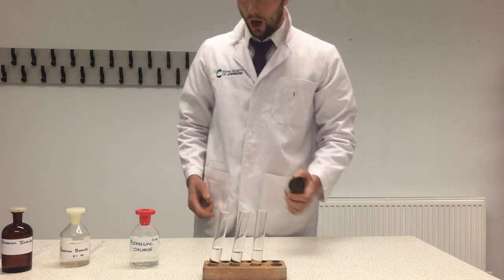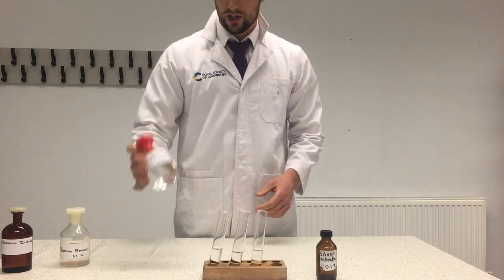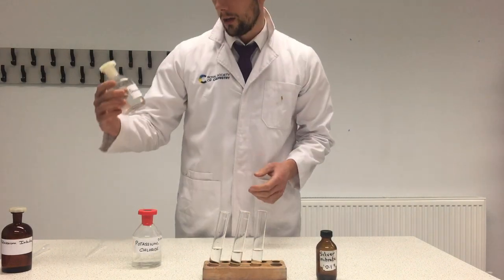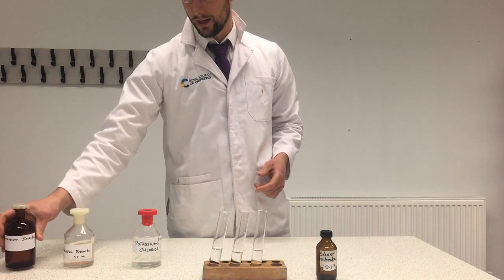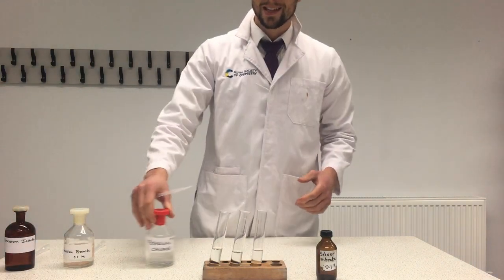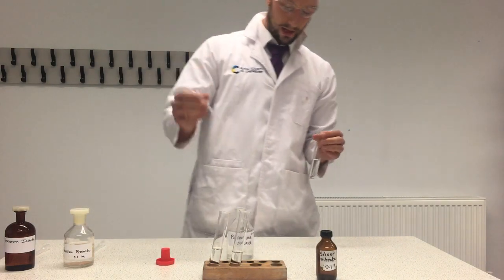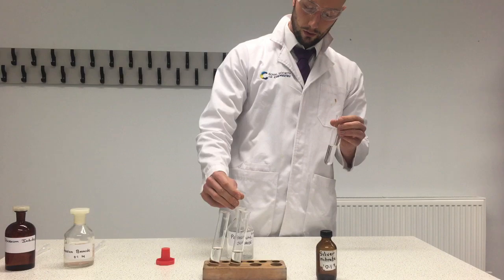I'm going to add to them three halide salt solutions: potassium chloride, potassium bromide, and potassium iodide. We're going to watch what happens with each of them — this is how we test what halide is present in a salt. First, I'll take one of my boiling tubes and a pipette full of potassium chloride.